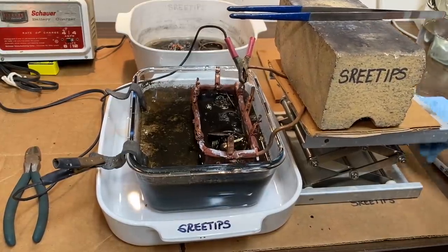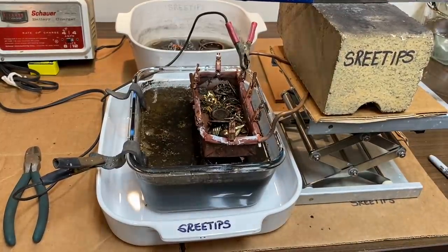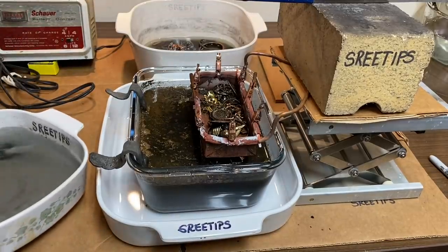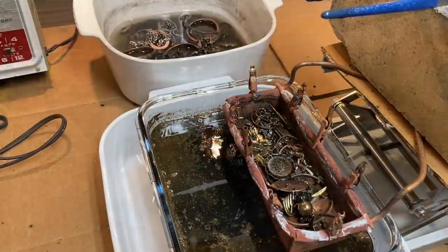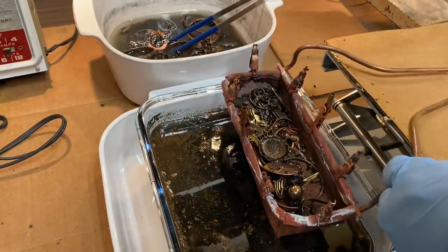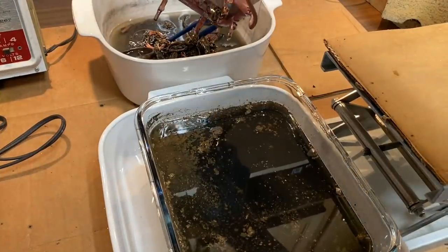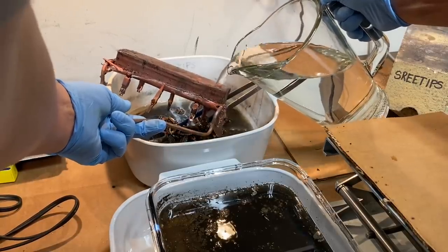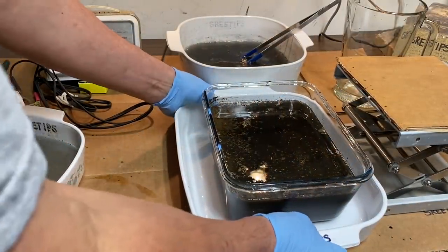Now what I'm going to do is disassemble the cell. We're going to take our saturated electrolyte out and put it by the fume hood to continue our work. Let's dump this last few bits into our waste container and then rinse it off with some tap water to get all the black powder off. I'm going to move the electrolyte with the gold in it out to the fume hood now.